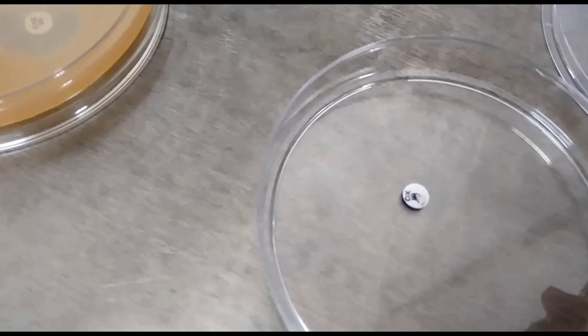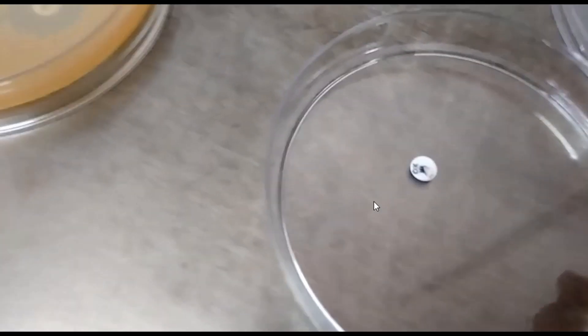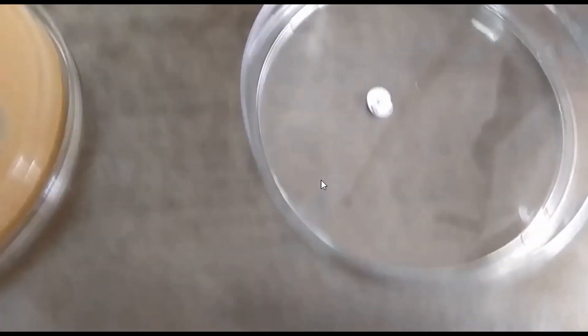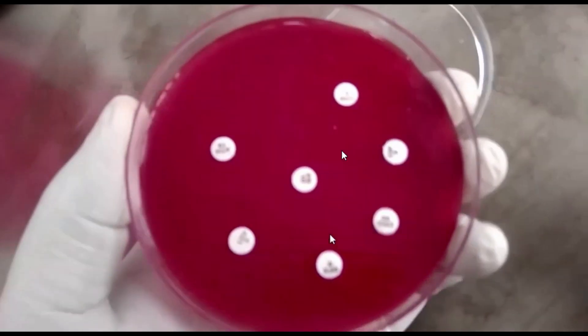So the bacteria is oxidase positive. Similarly, testing another bacteria. Yes, here you can see positive. For detail about this test, check description box. I hope this clip will be helpful.